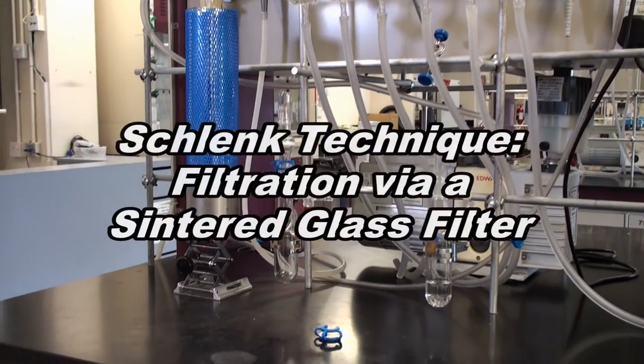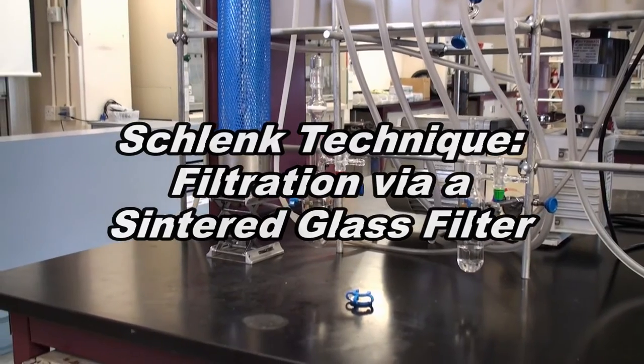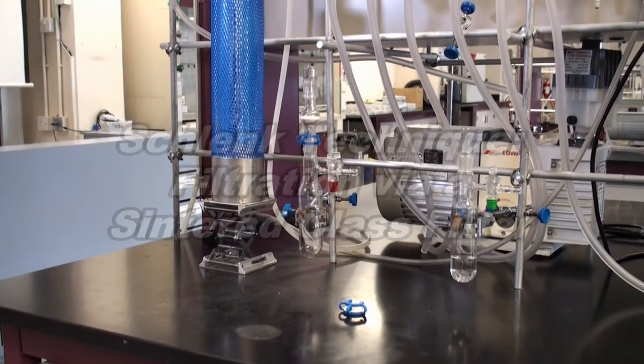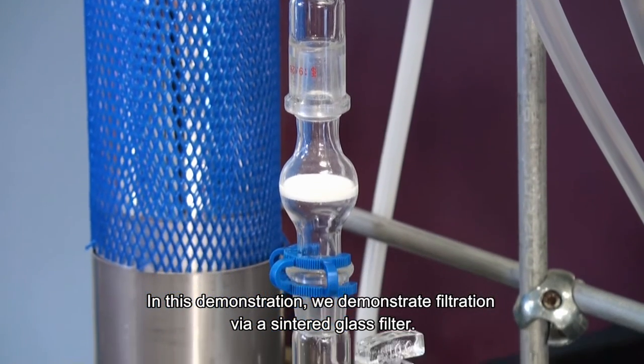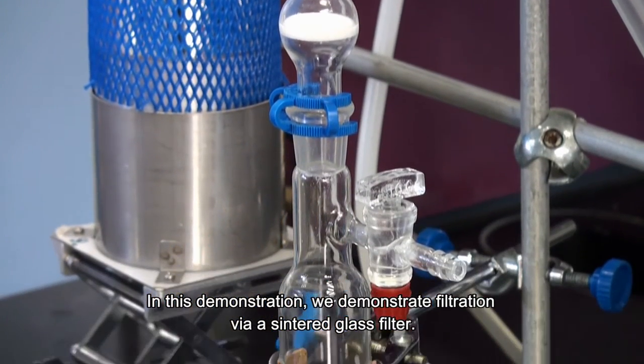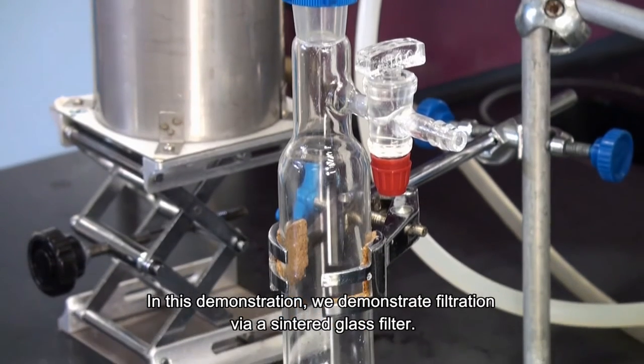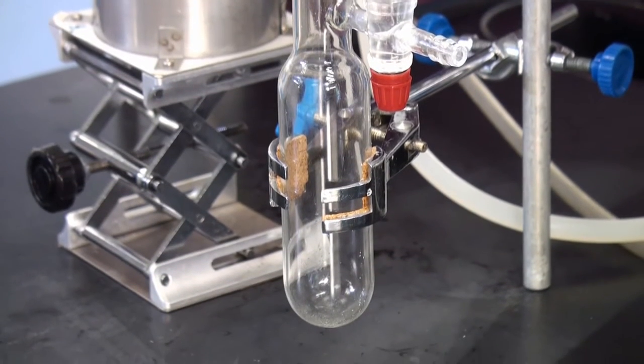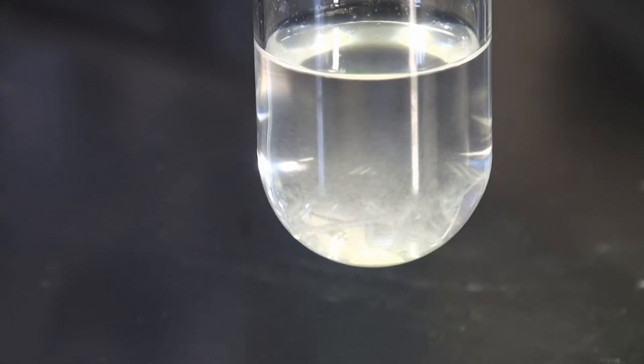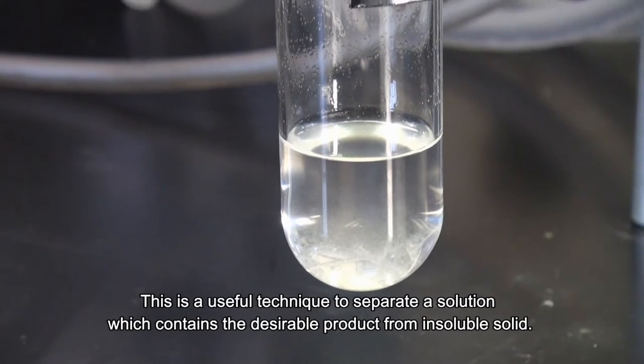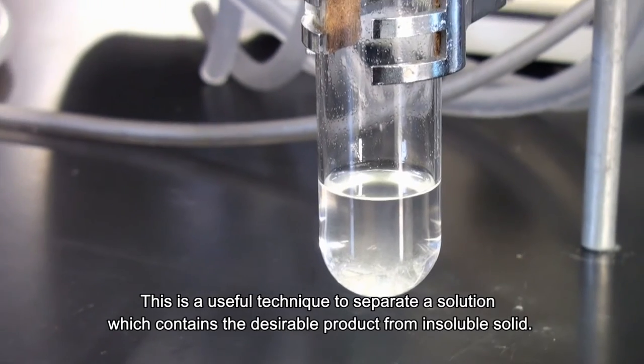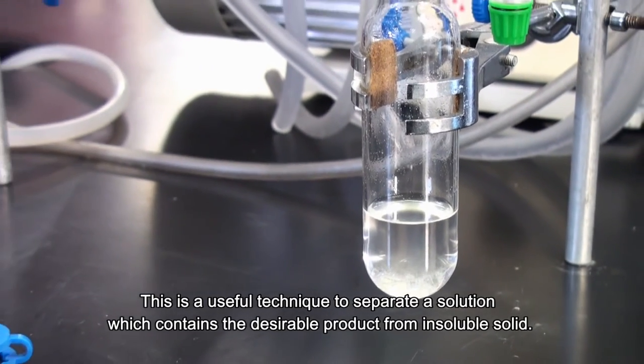Schlenk Technique Filtration via a Sintered Glass Filter. In this demonstration, we demonstrate filtration via a sintered glass filter. This is a useful technique to separate a solution which contains the desirable product from insoluble solid.